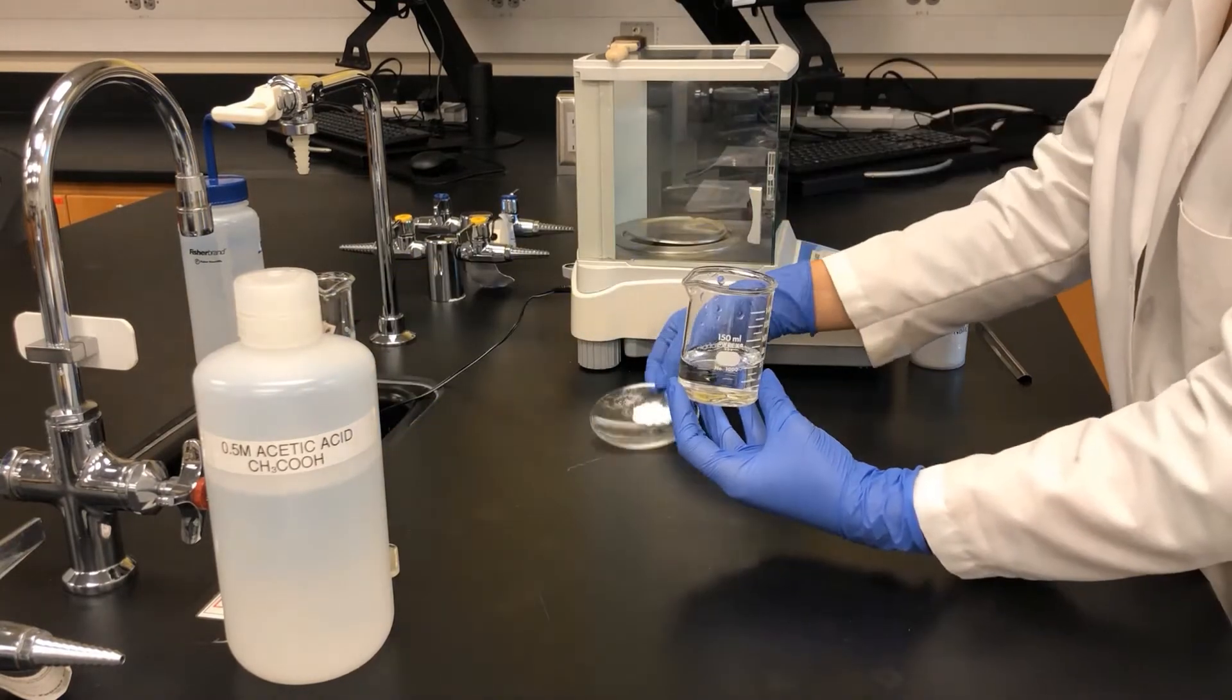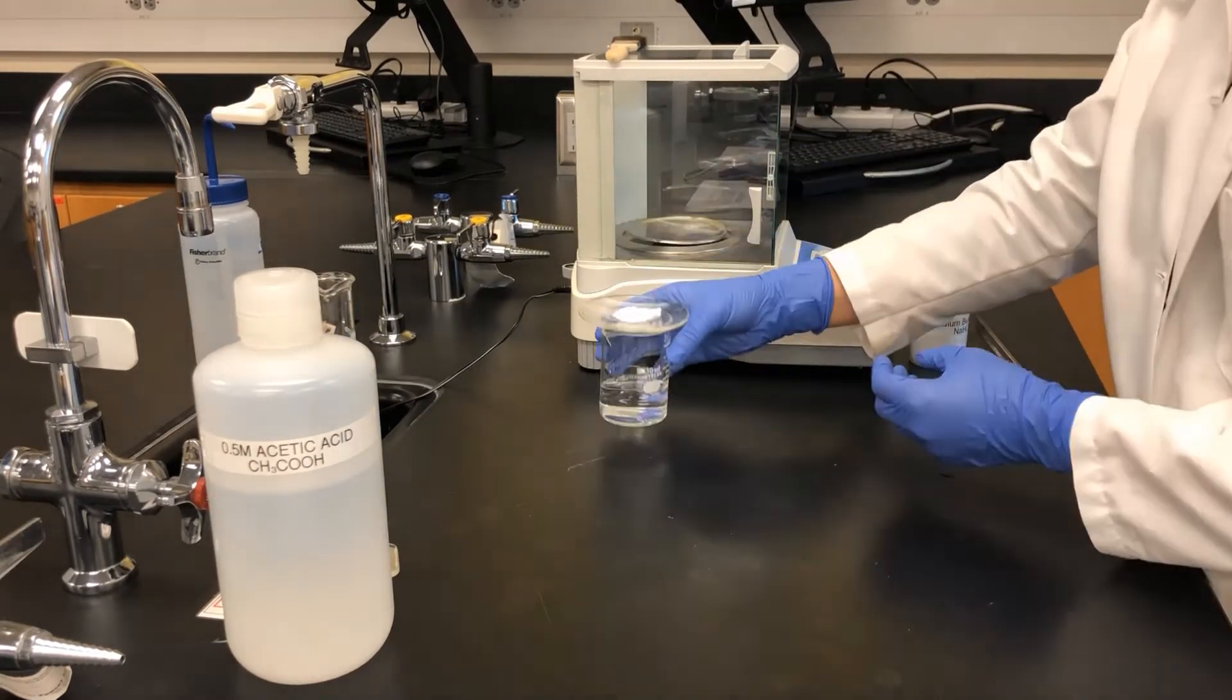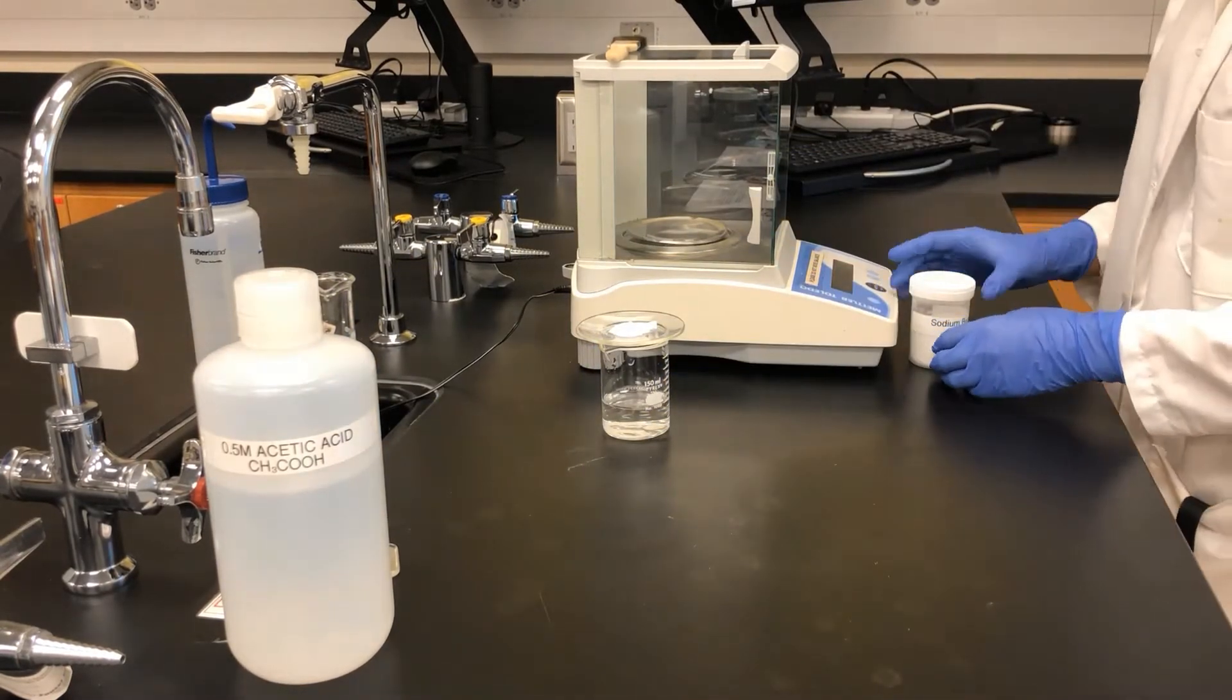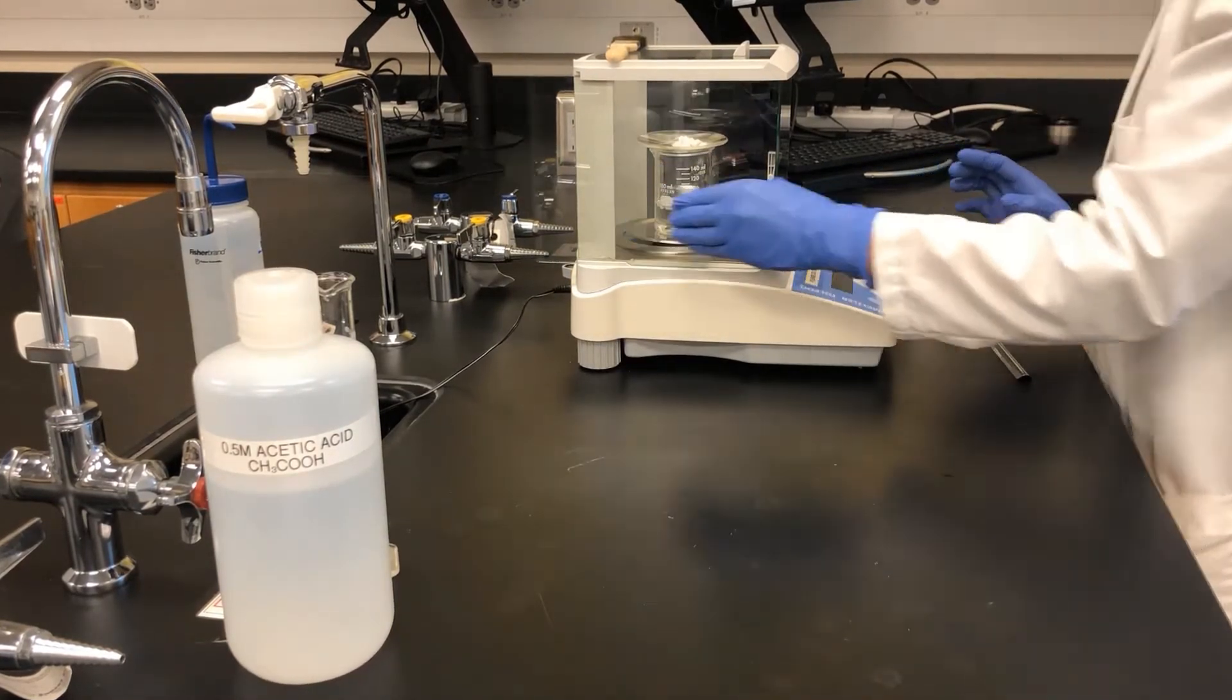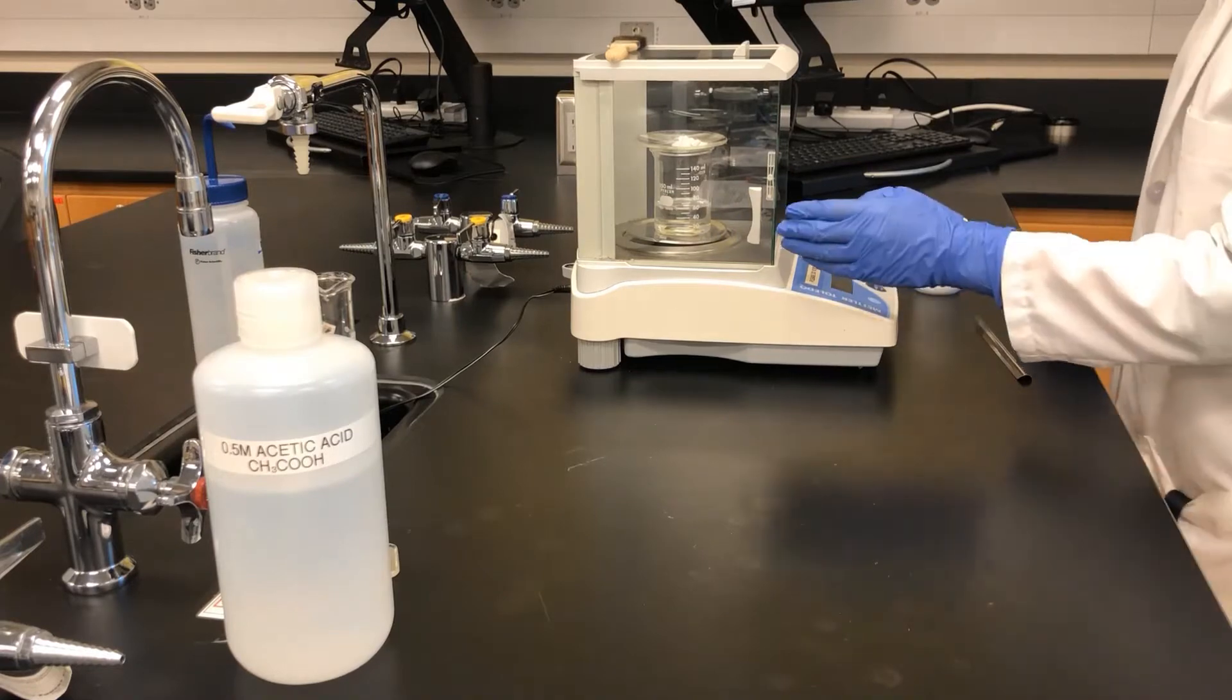The watch glass containing the sodium bicarbonate is placed on top. After the balance has been zeroed, the entire experimental setup is placed on the balance and the mass measured and recorded.